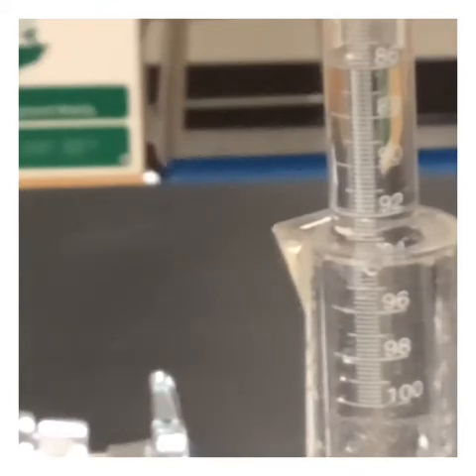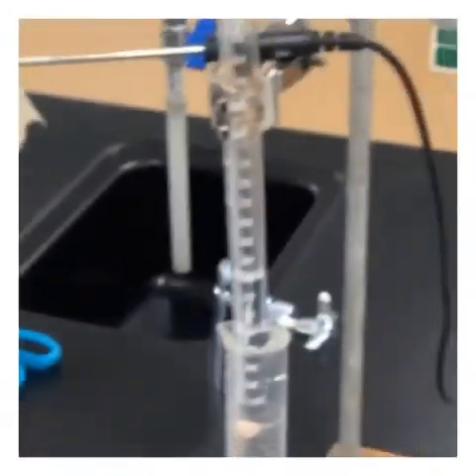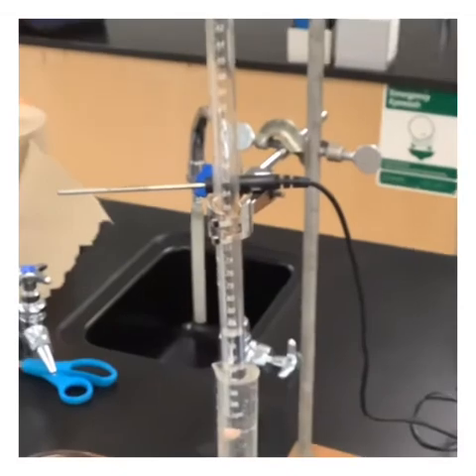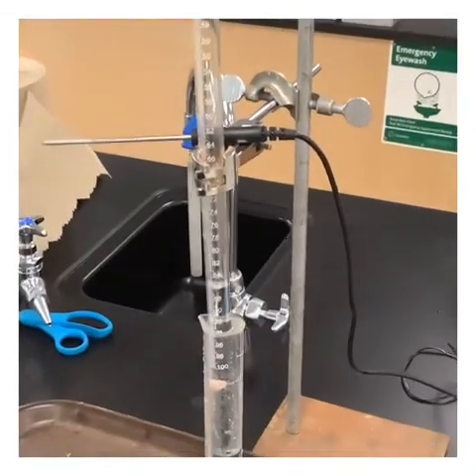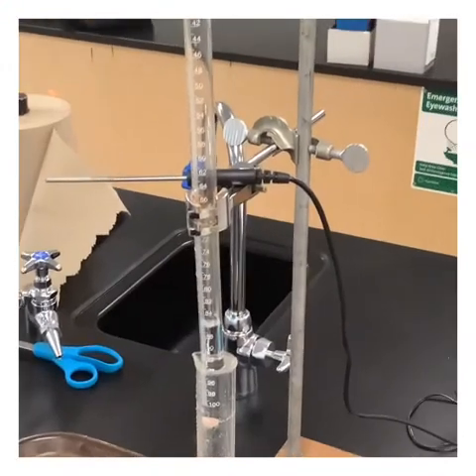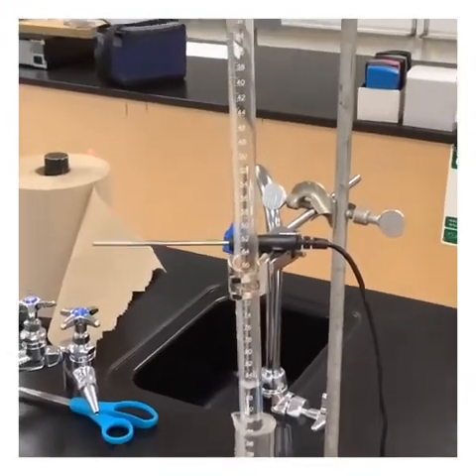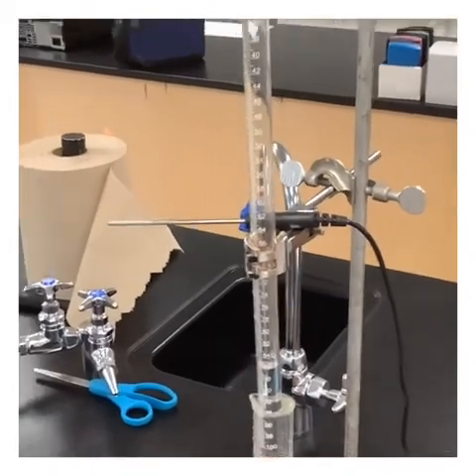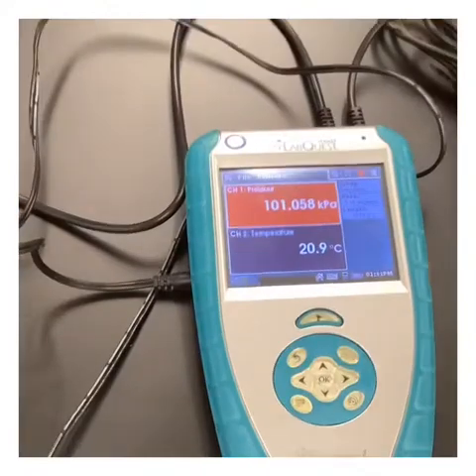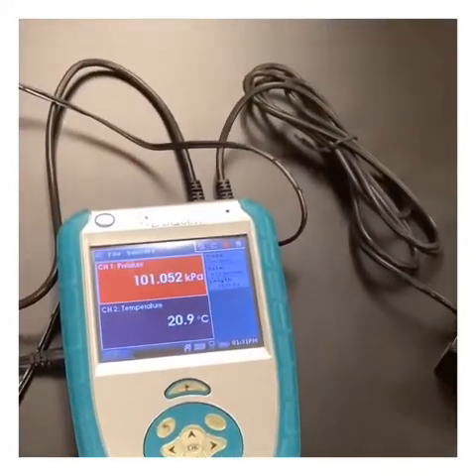Okay, next thing we need is temperature here. You'll notice that across the top, let me zoom out a little bit here, I laid a thermometer so that the idea is we need to know the temperature of that gas inside. It's been sitting here for a few minutes, so I would guess that it's just about the same temperature as the air around us. So I set it out in the air like that. We can go ahead and take a look at what we've got. I've got a temperature and I have today's pressure reading.